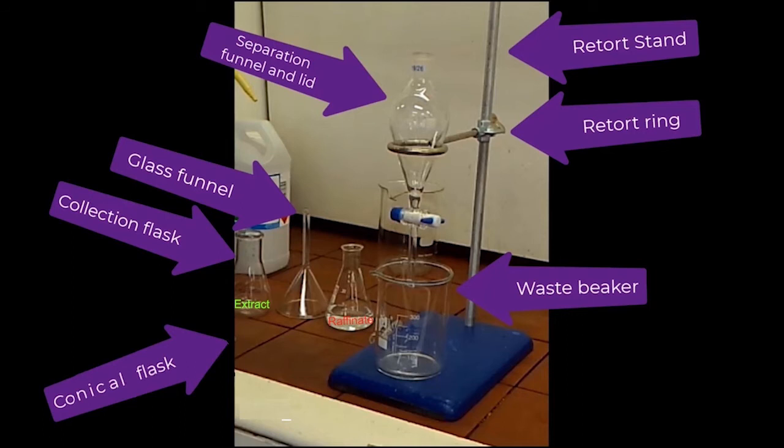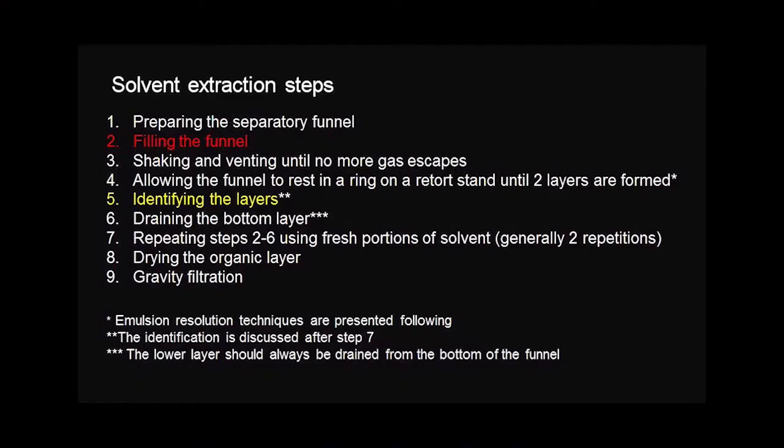Once you have these and the set up as shown, you are ready to start using the separation funnel.